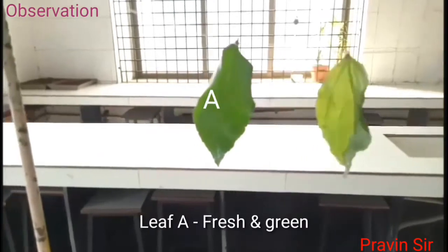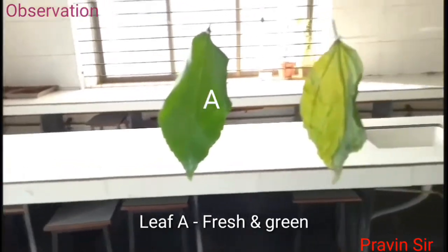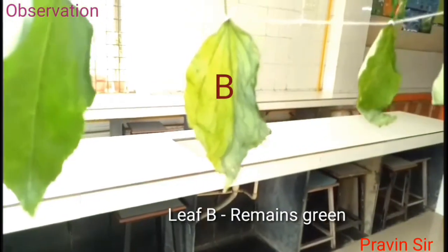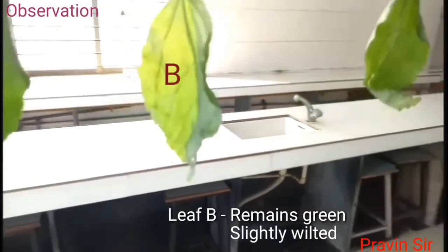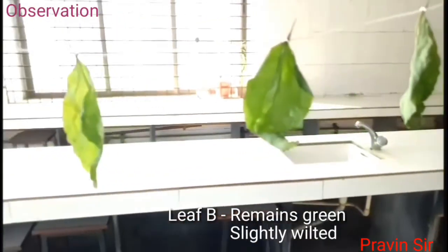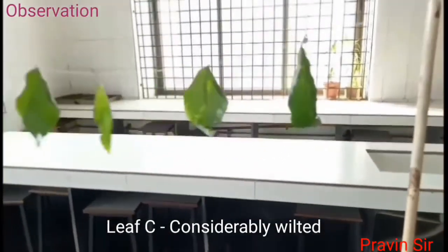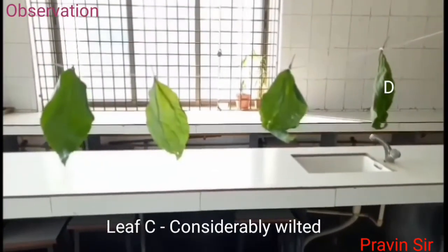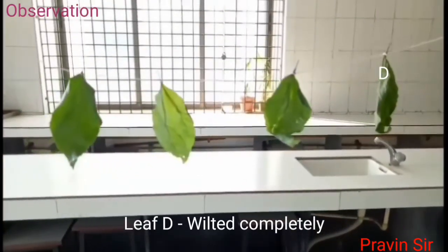Observation: Leaf A is fresh and green since vaseline was applied on both surfaces. Leaf B remains green like leaf A but is slightly wilted since vaseline was applied on the lower surface. Leaf C is considerably wilted since vaseline was applied on the upper surface. Leaf D wilted completely and shrivelled to a large extent.